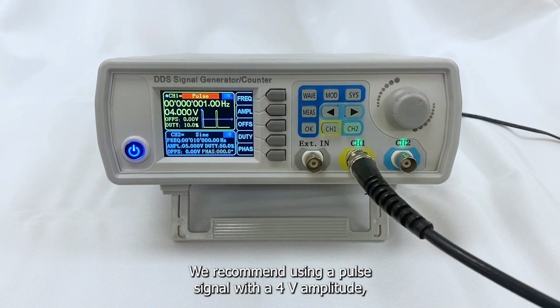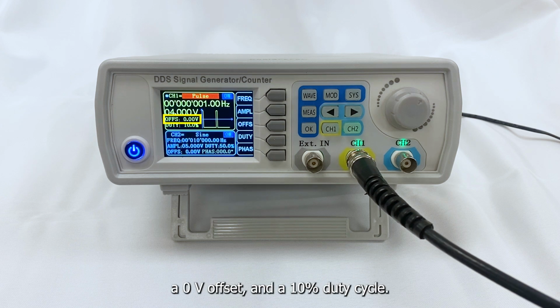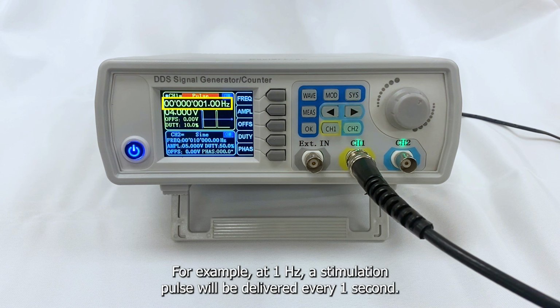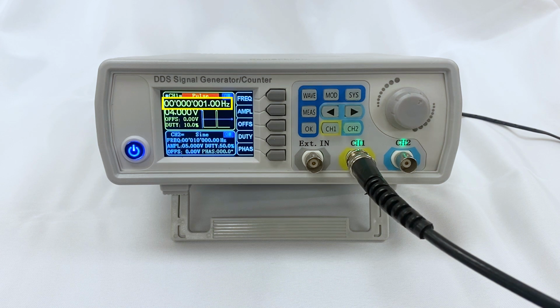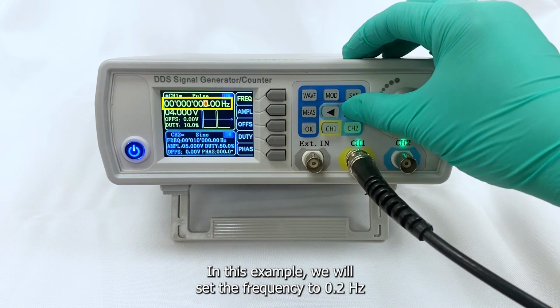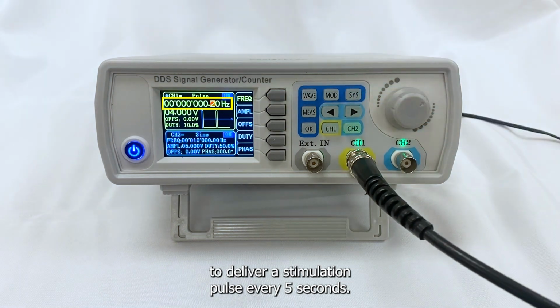We recommend using a pulse signal with a 4-volt amplitude, a 0-volt offset, and a 10% duty cycle. Set the frequency to the desired stimulation rate. For example, at 1 Hz, a stimulation pulse will be delivered every 1 second. In this example, we will set the frequency to 0.2 Hz to deliver a stimulation pulse every 5 seconds.